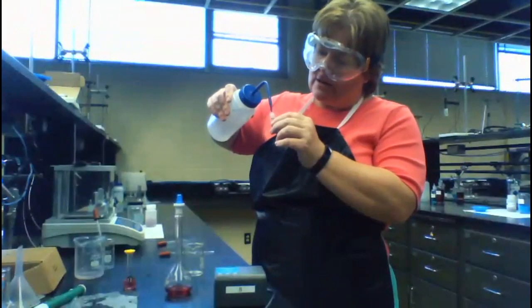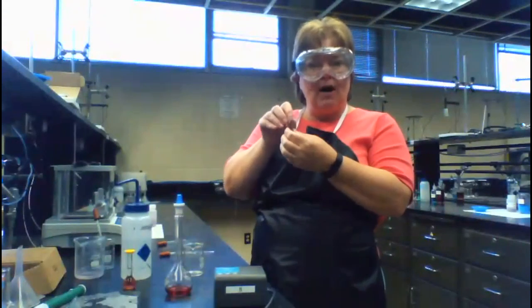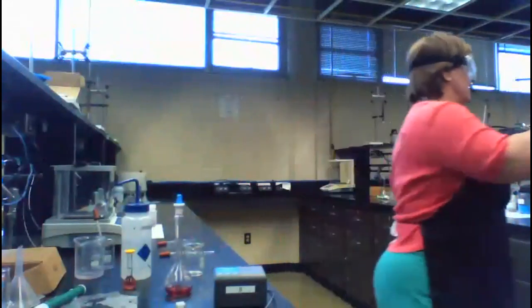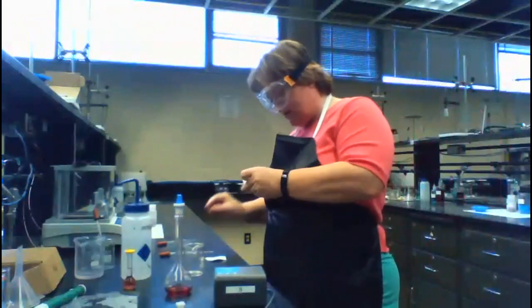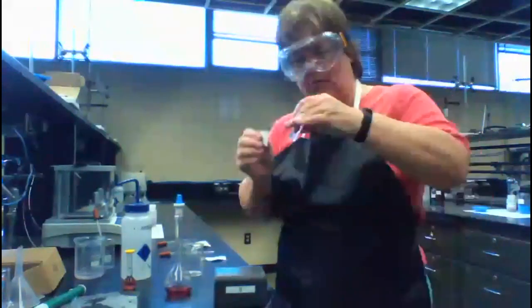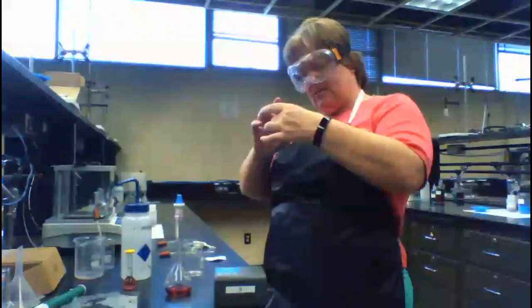Not all the way to the top, but pretty close, 3/4 of the way at least. I can put the little cap on. So I'm making one with water. I need water to be kind of my control. I want to wipe down the sides with a Kim wipe or with some little alcohol wipes, so I make sure I've got nice clear windows. I'm holding the ribbed sides so I don't get fingerprints on the other sides, and I'm just wiping them down. It almost looks like I have an air bubble here.